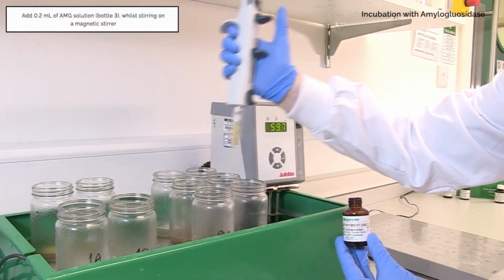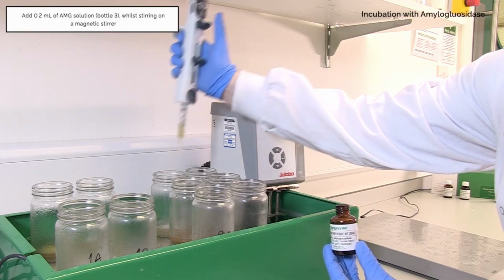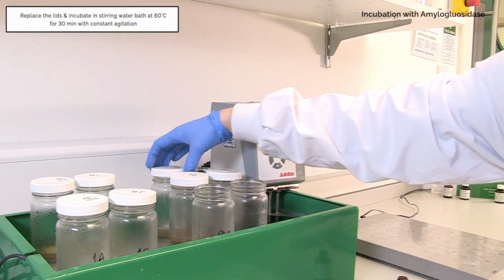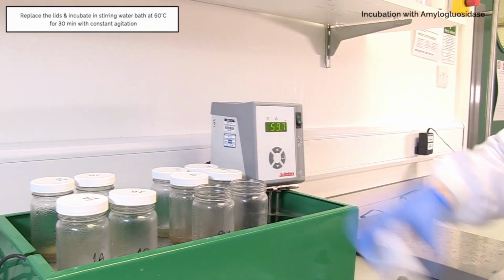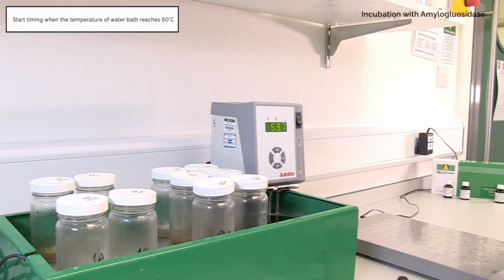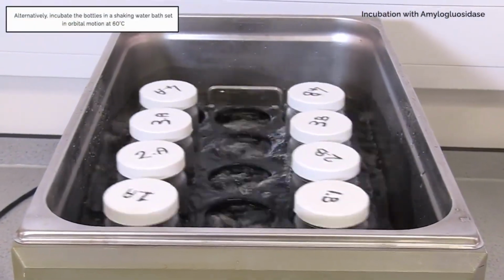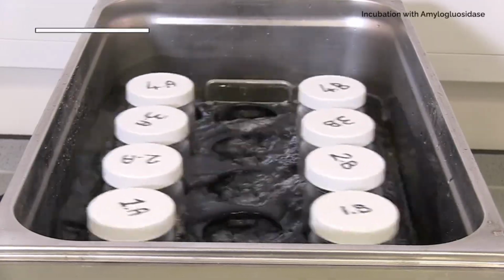Add 0.2 milliliters of amyloglucosidase solution, bottle 3, while stirring on a magnetic stirrer. Replace the lids. Incubate at 60 degrees Celsius for 30 minutes with constant agitation. Start timing when the temperature of the water bath reaches 60 degrees Celsius. Alternatively, incubate the bottles in a shaking water bath, set in orbital motion at 60 degrees Celsius.